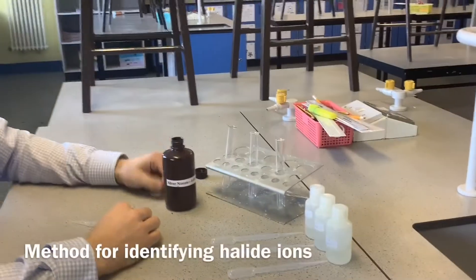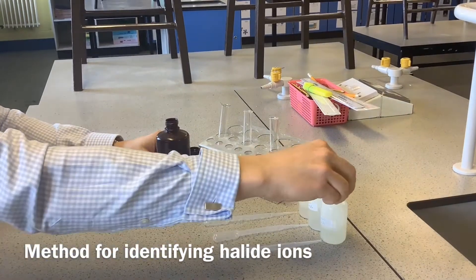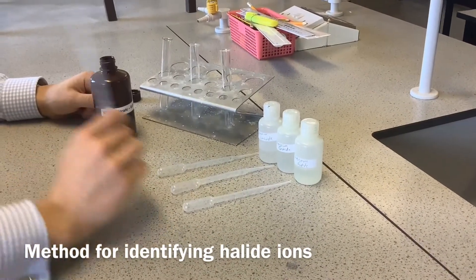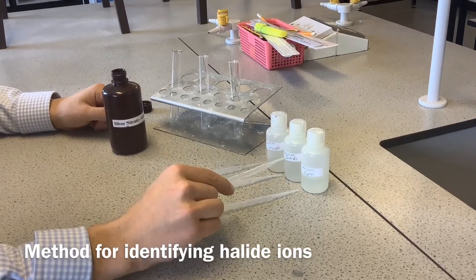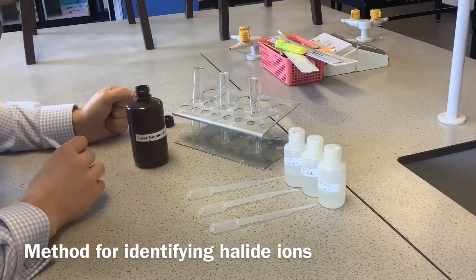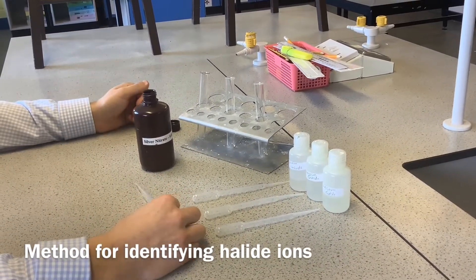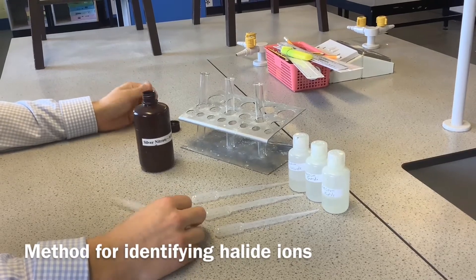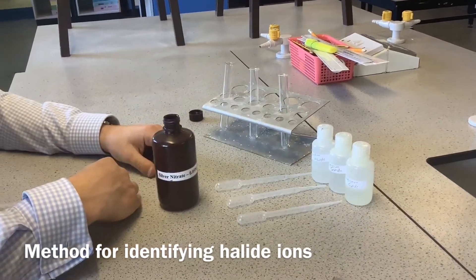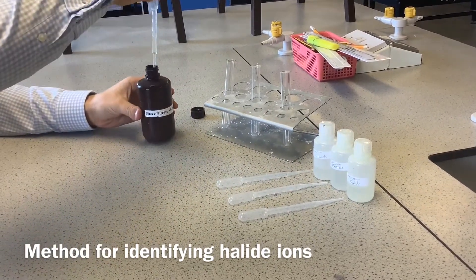So another experiment here — it's a specified practical for unit two, and it's about identifying the halogens, those are our group seven elements: chlorine, bromine, and iodine. We're identifying their ions: chloride, bromide, iodide. Quick point — we can't identify fluoride this way because it doesn't produce a precipitate, which is what we're looking for. So the first thing I'm going to do is put silver nitrate in every one of these test tubes.